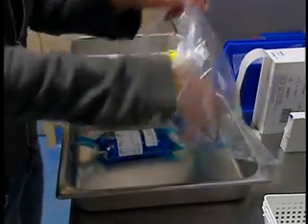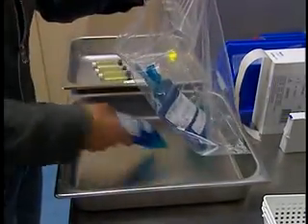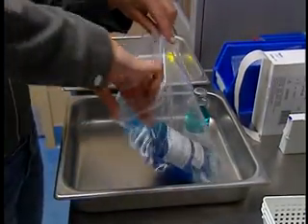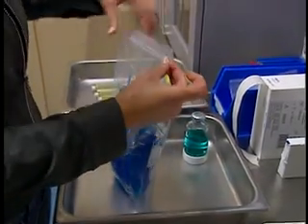Place syringes ready for administration and the solution bags in sealed bags before dispensing.